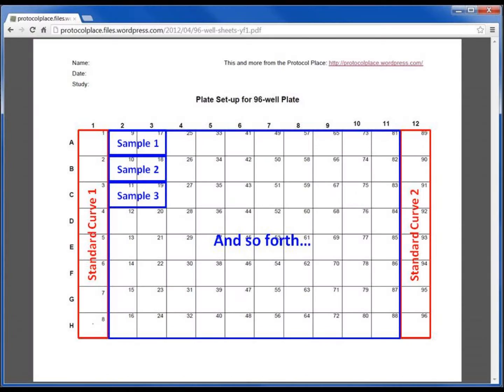I usually let the last wells of the standard curves be my blanks. This means they only contain reagent dilutant without protein. Blanks are necessary for subtracting out background signal during data analysis.